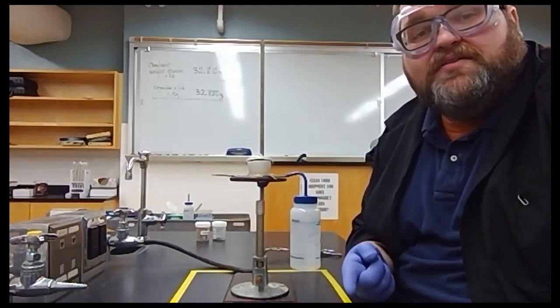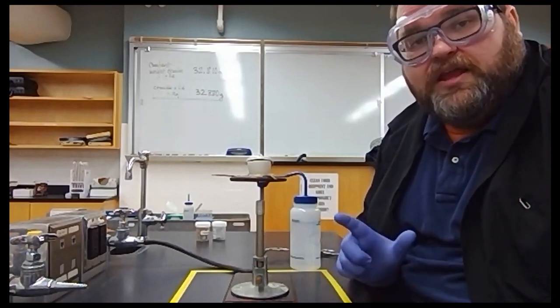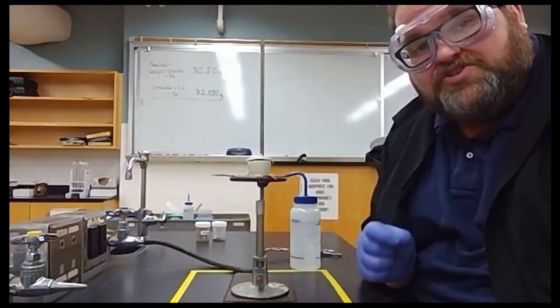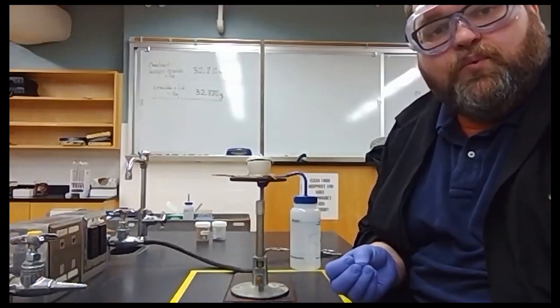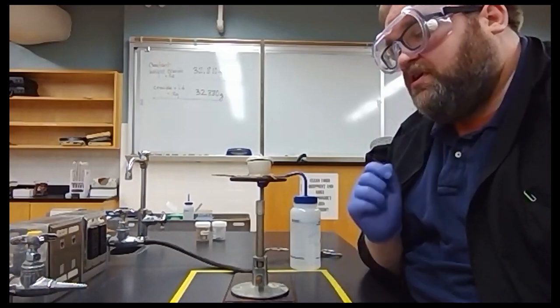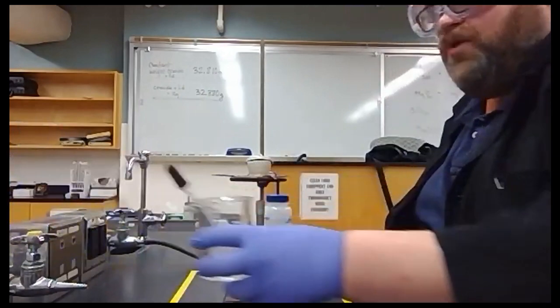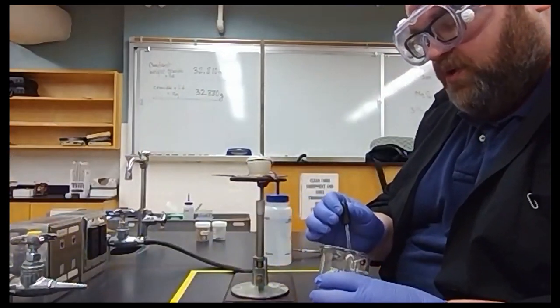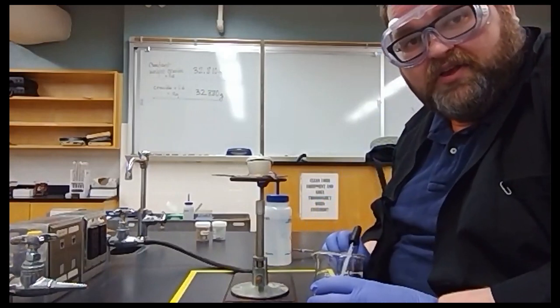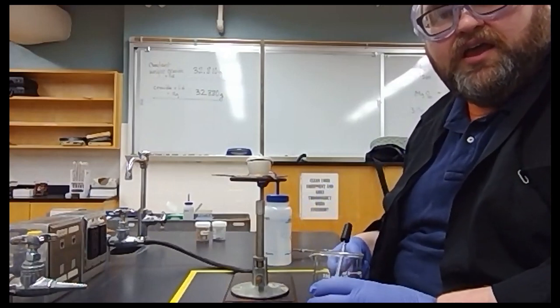Magnesium nitride in the presence of water will convert to magnesium hydroxide, Mg(OH)2. Magnesium hydroxide can be dehydrated. If I heat it intensely, water will come off of it and we'll be left with magnesium oxide. So that's what we're going to do. We're going to take that magnesium nitride and add some deionized water to it. Okay? The deionized water is going to convert the magnesium nitride to magnesium hydroxide. Then we're going to put it back on the heat and convert the magnesium hydroxide to magnesium oxide.